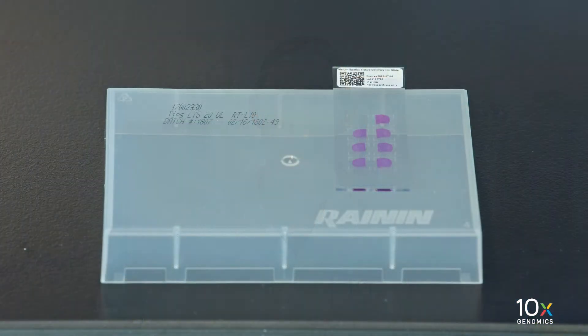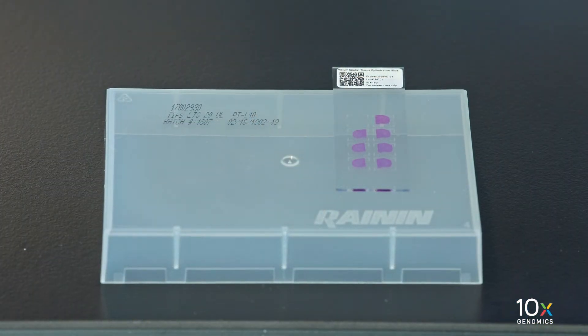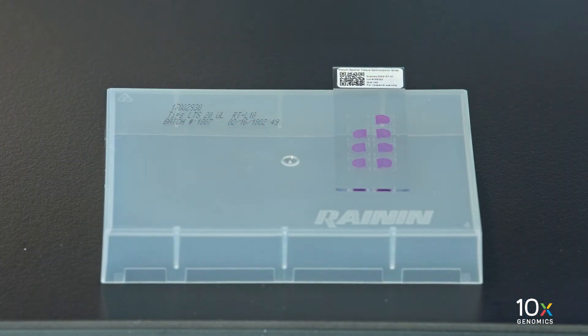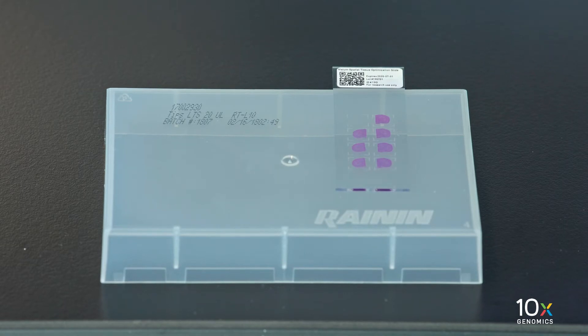We have fixed and stained the tissue. We are now ready to image the tissue using Brightfield settings. We have our Visium Spatial Tissue Optimization slide with the fixed and stained tissue.